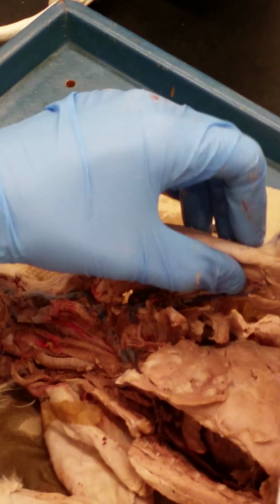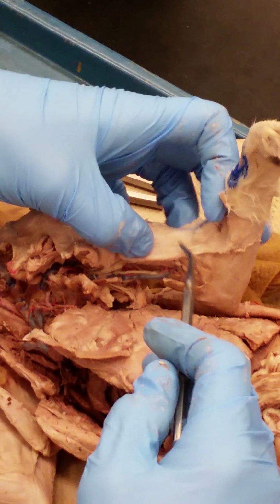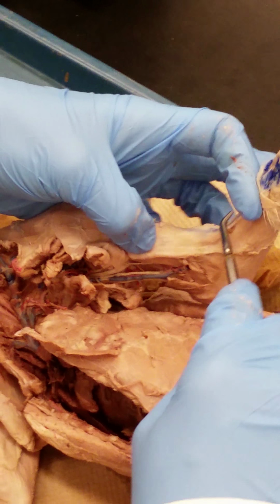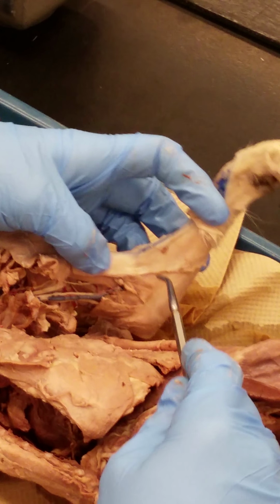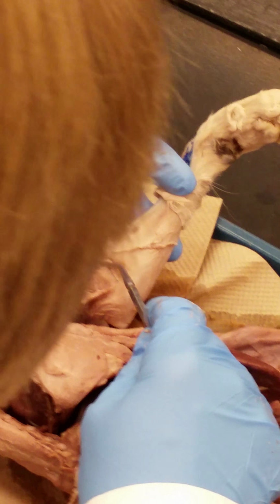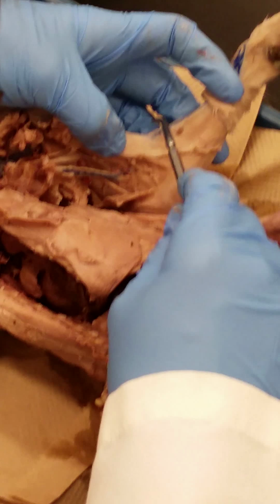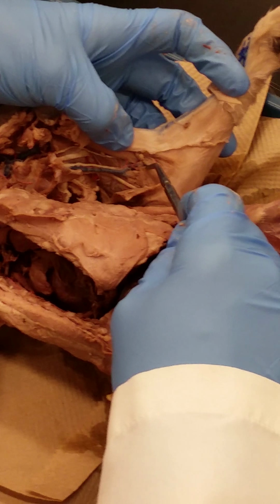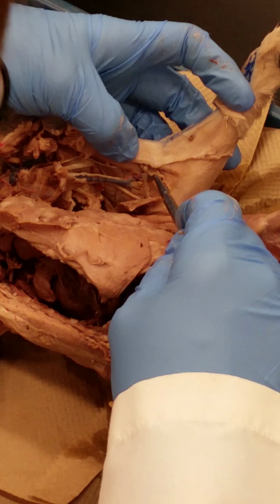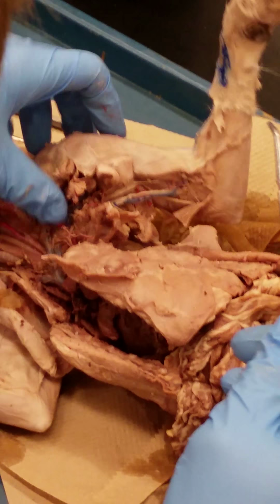And if we follow it down a little bit further, this is not the best example, but you can see that we have the cephalic vein going down the anterior surface of the forelimb, and there is, this one's broken, but the vein that crosses over between the cephalic and the brachial veins would be the median cubital vein. So there may be another kitty where you can see that better, but that can show up on the practical.